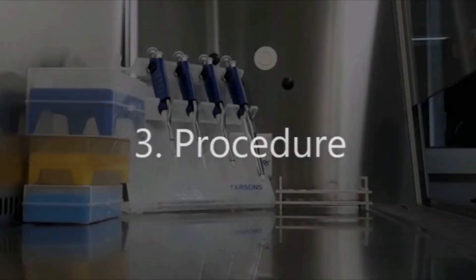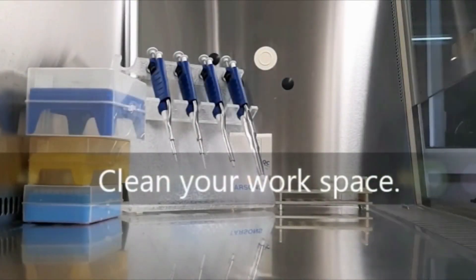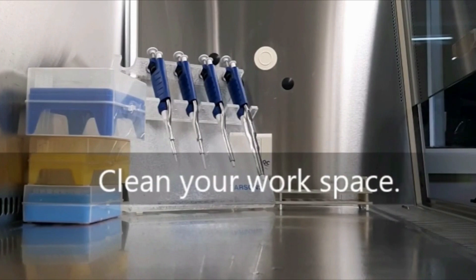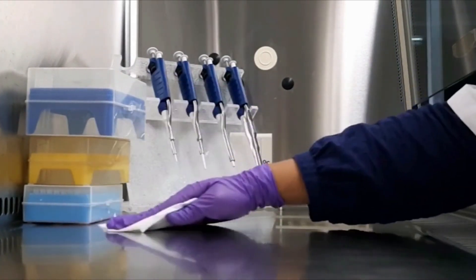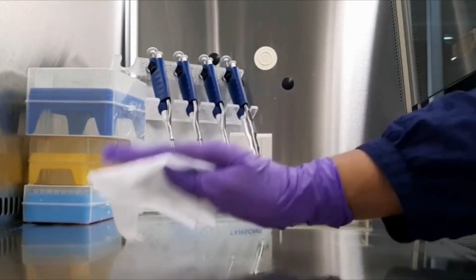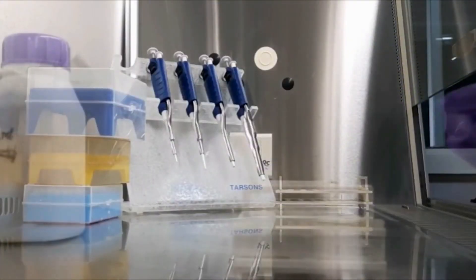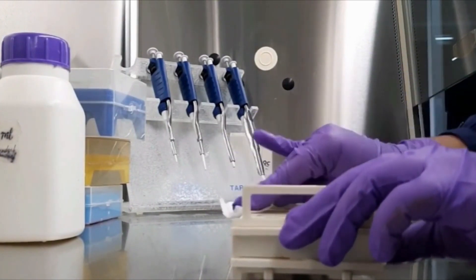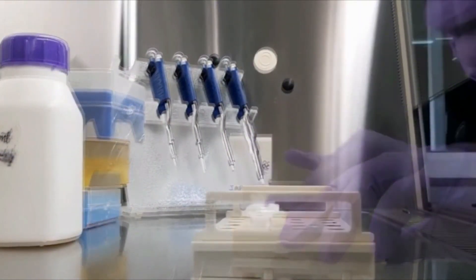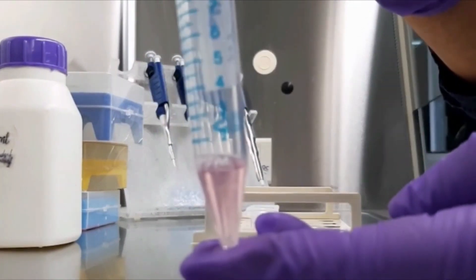Now we will go to the procedure. First, before starting, make sure you are working in a biosafety cabinet. Clean your working space by spraying ethanol over the entire area, wiping the stand and surfaces to make sure it is free of any contaminants and sterile.